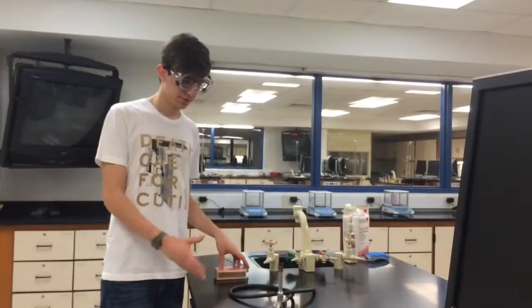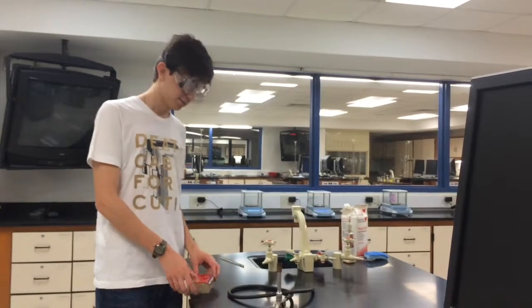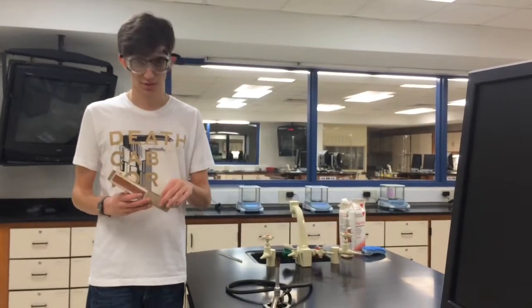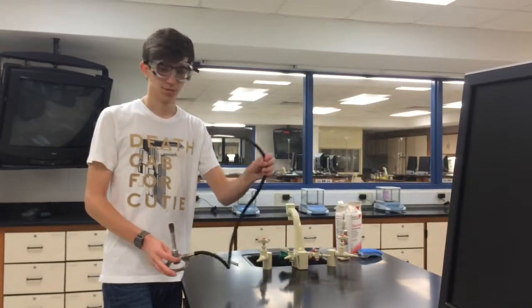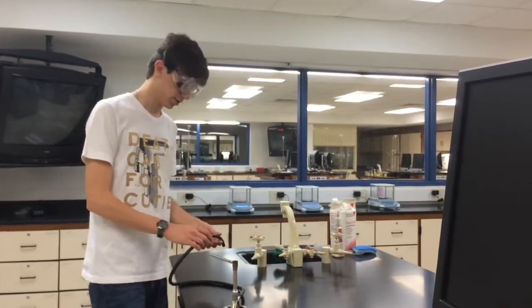Now actually proceeding with starting the fire on the Bunsen burner and keeping it controlled. Step 1 is to get yourself a box of matches, and then also some matches, of course, so you can start the fire. And getting your Bunsen burner with this rubber tube, which is going to put the gas through the Bunsen burner.